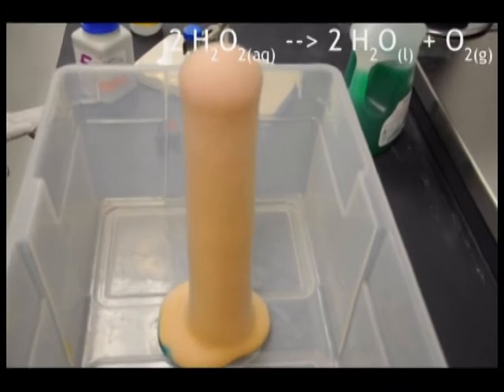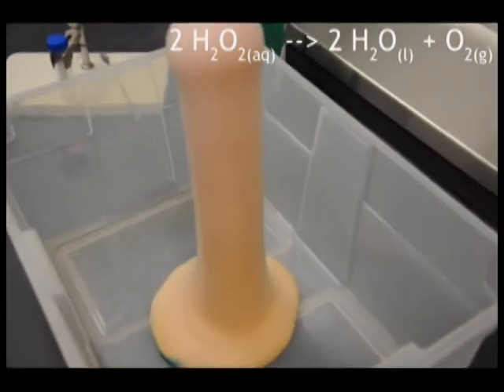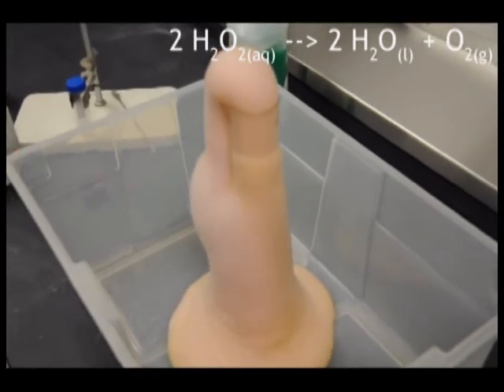The oxygen gas formed by the reaction is being trapped by the soap. So as more and more oxygen is created, the volume of the foam grows.